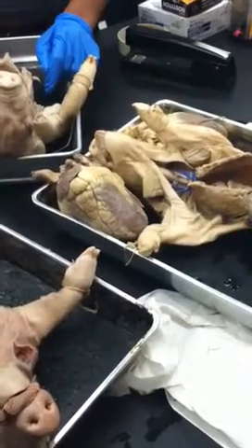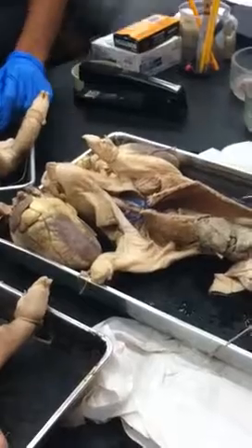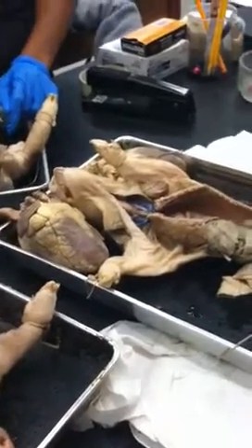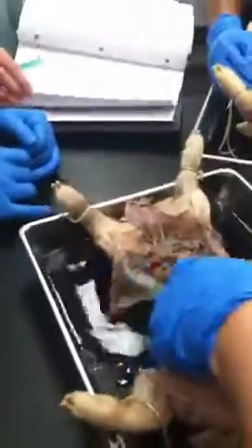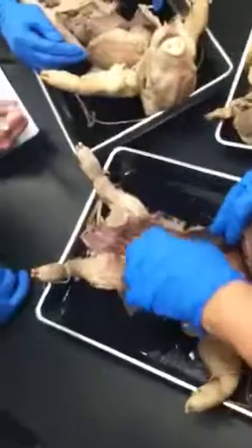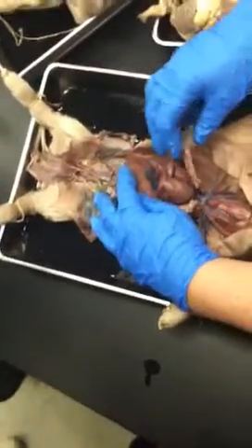Okay, so posterior vessels. Posterior, I try to do it in 5 minutes. Okay, posterior vessels. Usually I start on this side and then I switch to the arteries and then I go back to the veins.